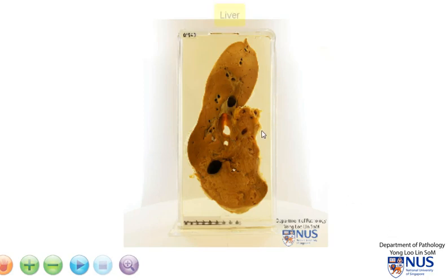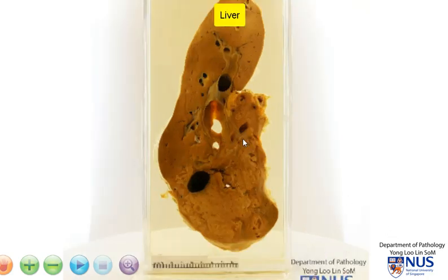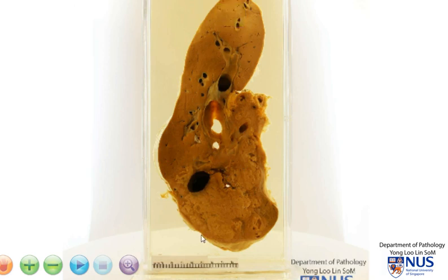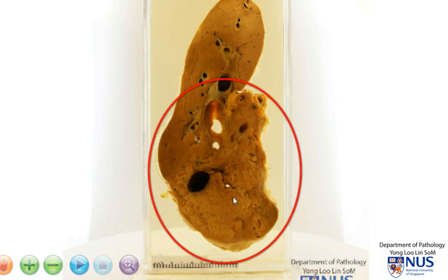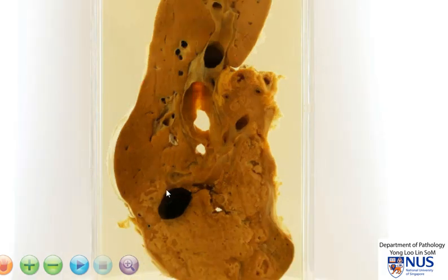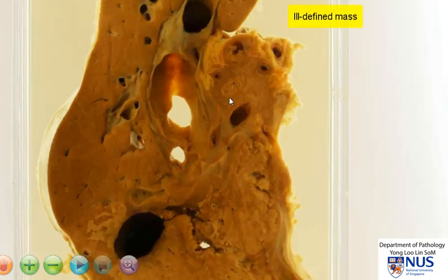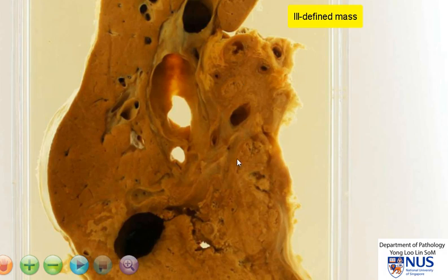We're looking at a slice of liver here, and the pathology that we are seeing is actually quite ill-defined. There is a mass located here, which is probably in the region of the right lobe. The interface between the mass and the liver is really very ill-defined, so it is not a sharply demarcated mass.